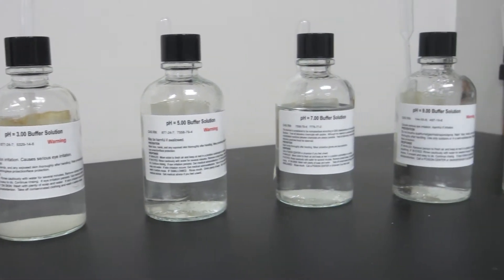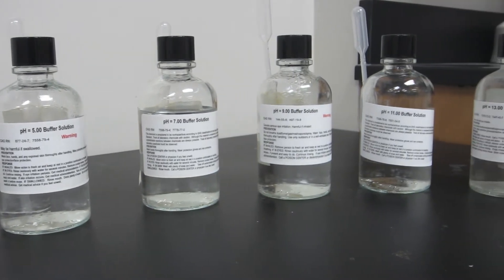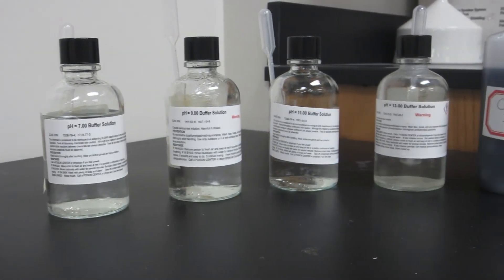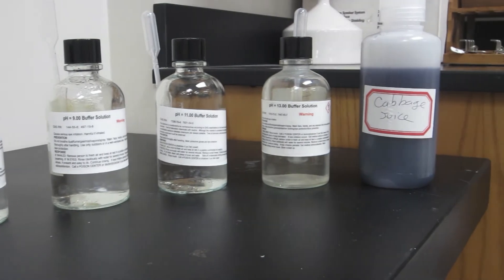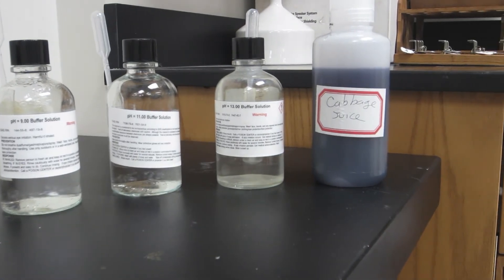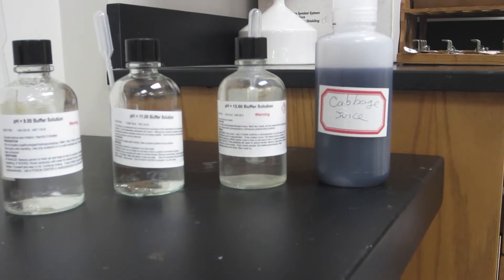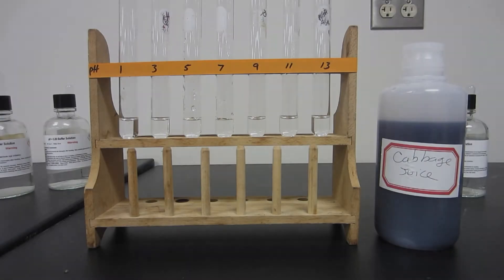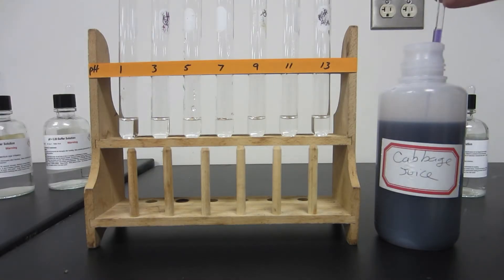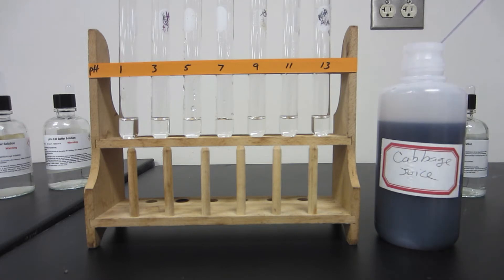Here are the buffer solutions — very simple solutions. They are different salt mixtures of molecules that have a tendency to maintain a particular pH: pH of 1, pH of 3, etc. We don't have the complete set here; it's just the odd-numbered ones. So just omit the even-numbered ones.